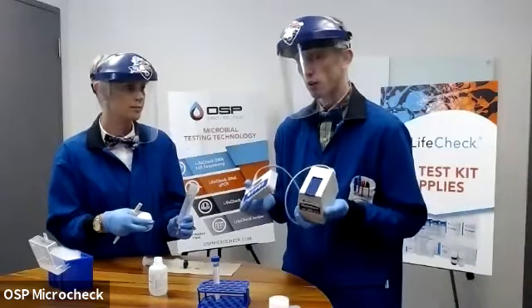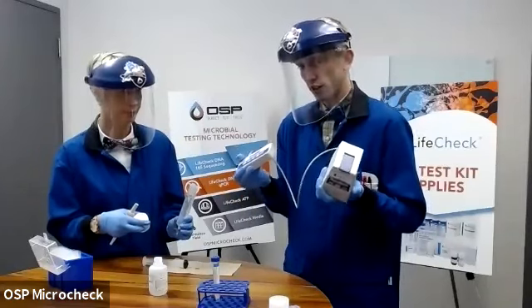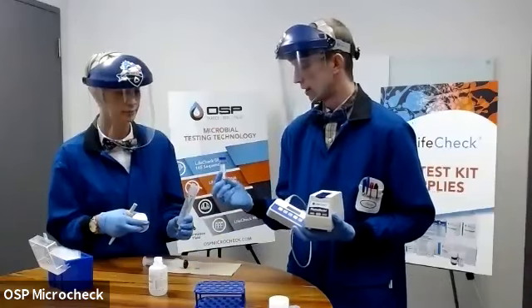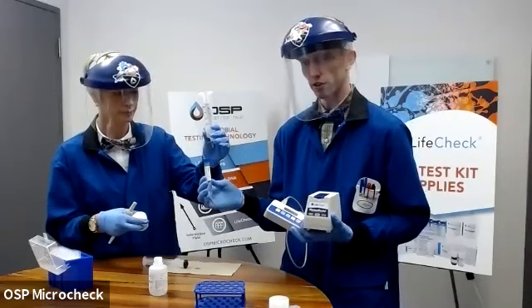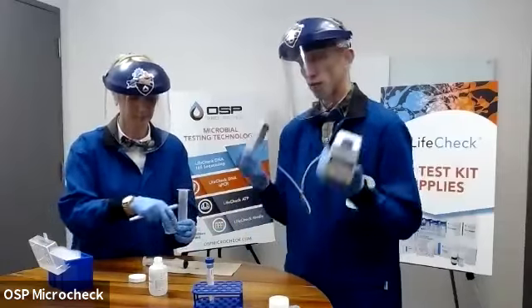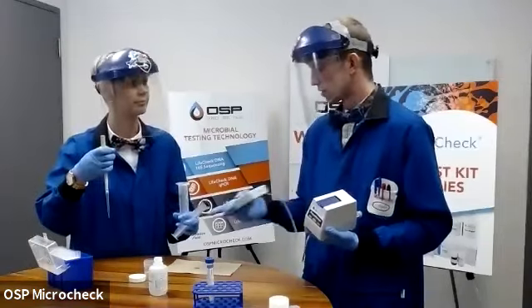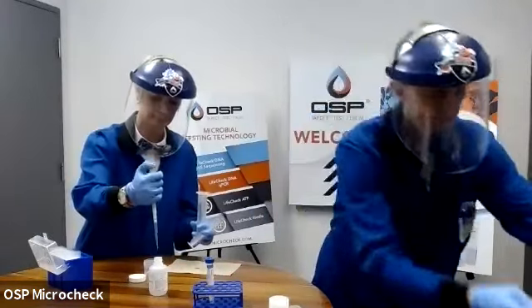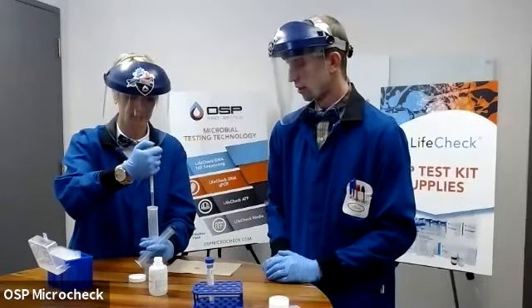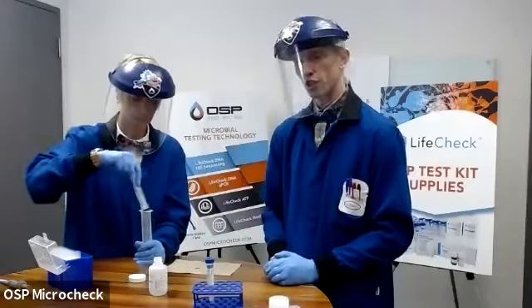Right. So if you have a luminometer on hand with you, best practice would indicate that you would finish your testing at this point and actually take the reading with your luminometer, which means that you might extract your ATP using Reagent X directly into this tube here, the Reagent D tube. In Virginia's case, we're going to move forward as though her only luminometer, the only one she has access to, is back at a field office somewhere, and she's out in the field. So she's going to elute into the field container. Notice her pipetter technique. She didn't hold it sideways or dump it upside down, and she's using a fresh tip each time.